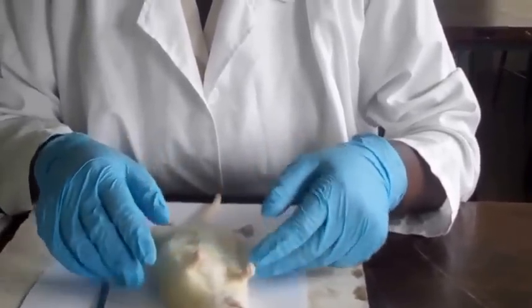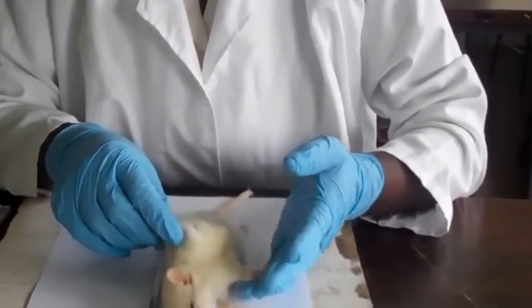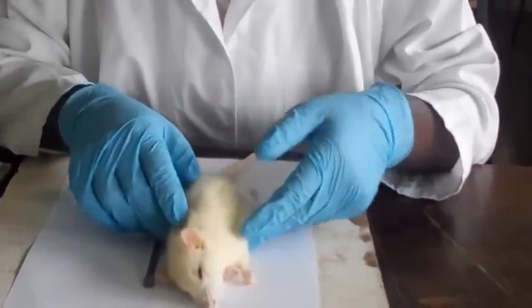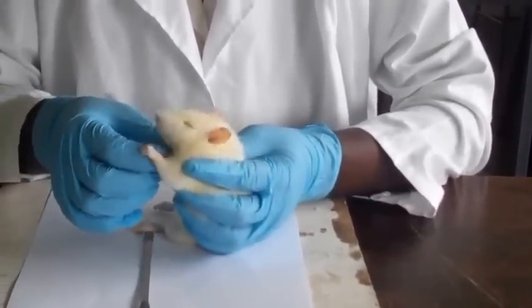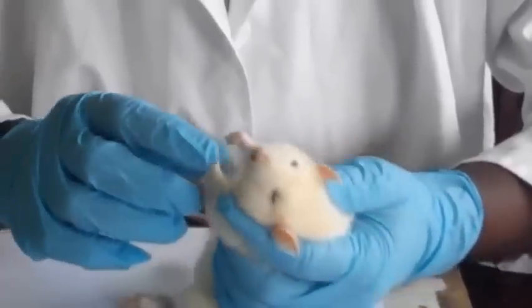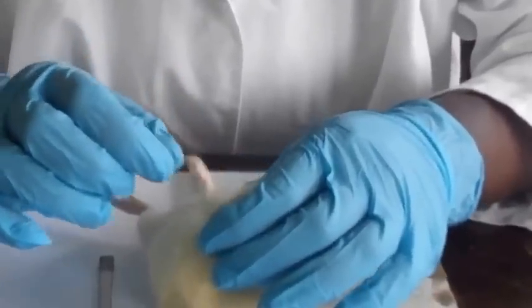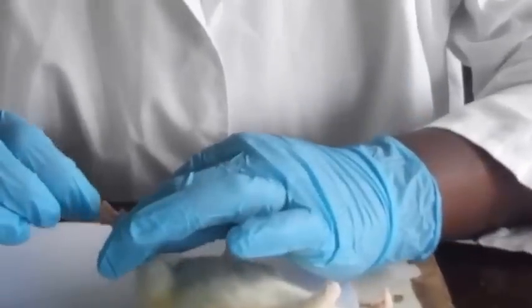Yeah, so we have the fur that covers most of the body. This is to conserve heat, and it's for protection from mechanical injury. Then we have the limbs. There are 4, as you can see, and they have 5 digits, and this is for stability and support. Then the digits are jointed, you can notice that they are jointed, and this is for flexibility and for grasping objects.